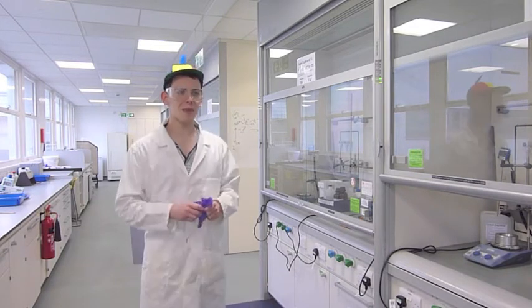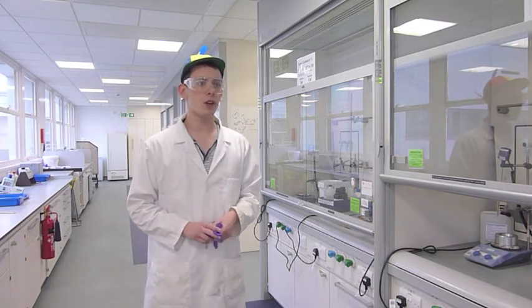So now we're in the lab. While in the lab, safety is our primary concern. So take a pair of these gloves. Gee, thanks, mister. So what am I doing today?